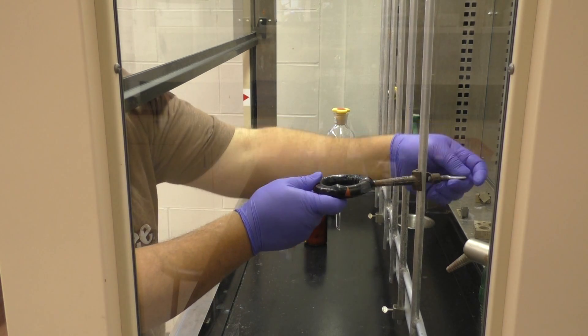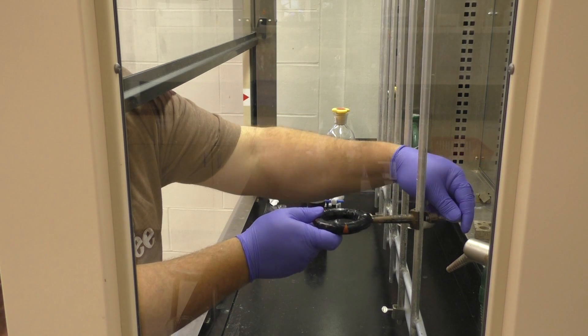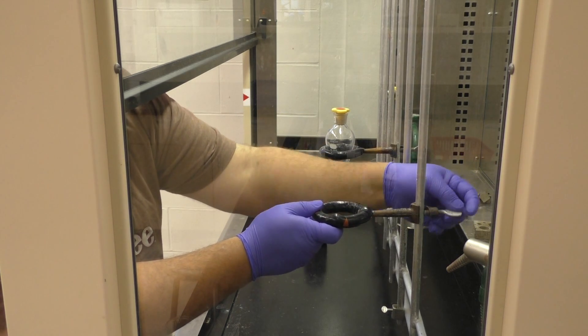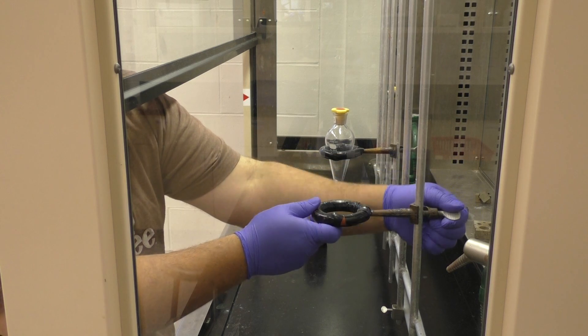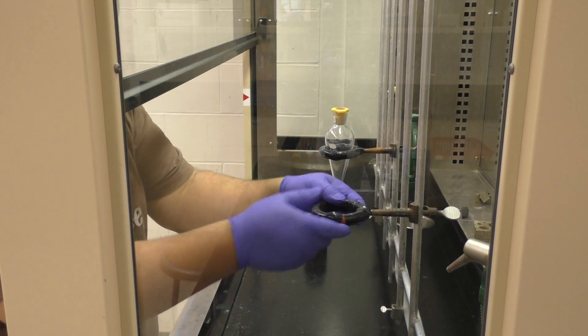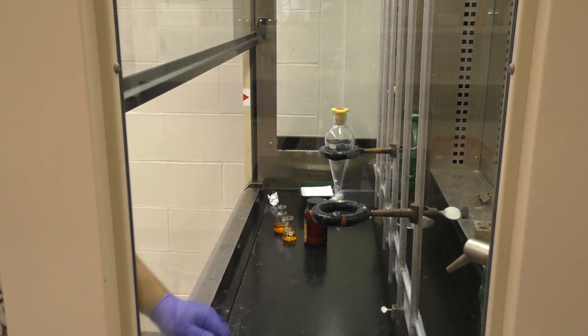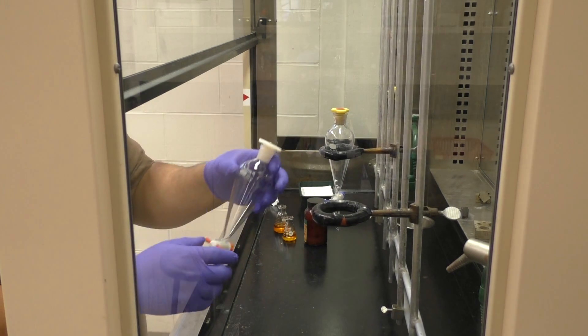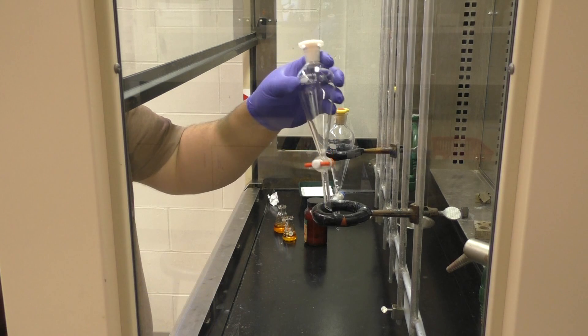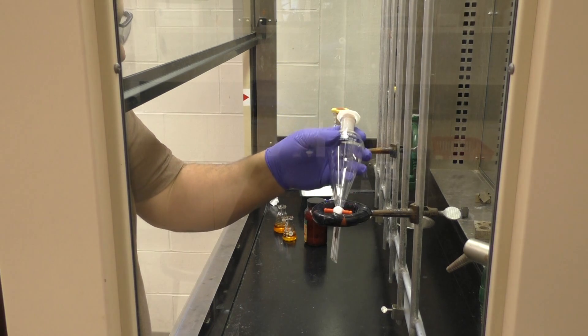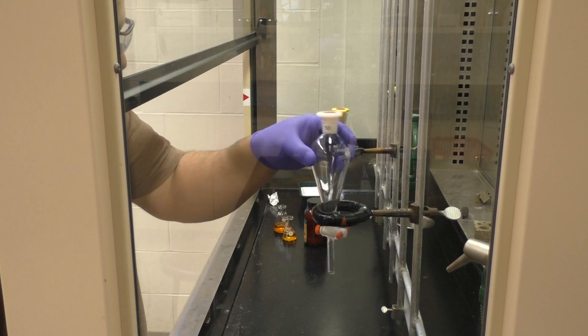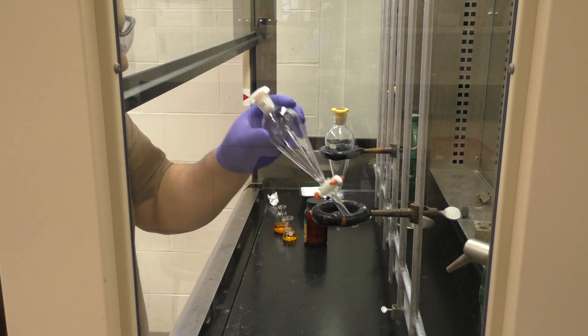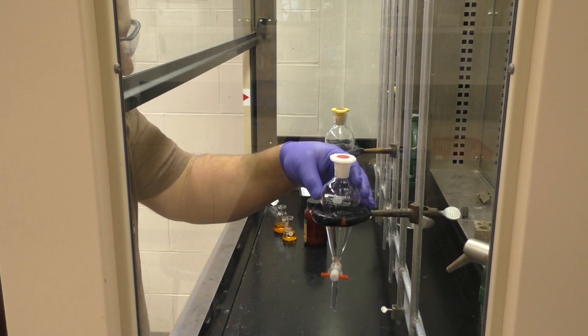Now, when you're not holding it, there's an iron ring you can get in the drawer underneath the fume hood, the top drawer there. You can clamp it onto the scaffolding. Some of these are a little old, so after you've tightened it, make sure you check it's not going anywhere. The sub funnel itself will not directly fit through. You have to kind of angle it in. So just be aware of that. Don't try and force the thing through.